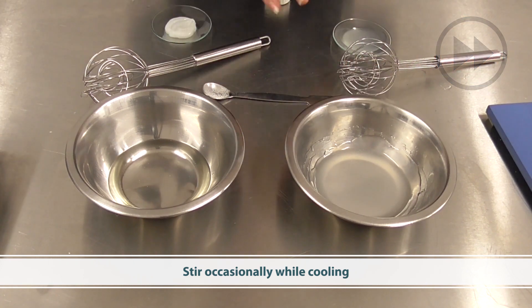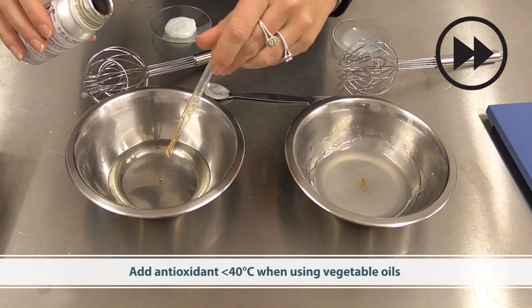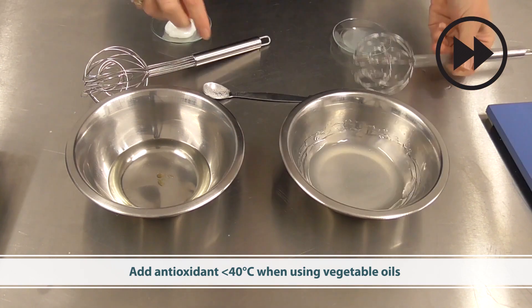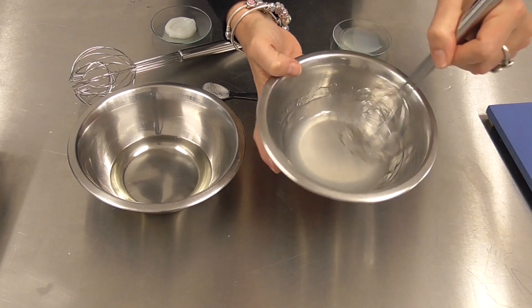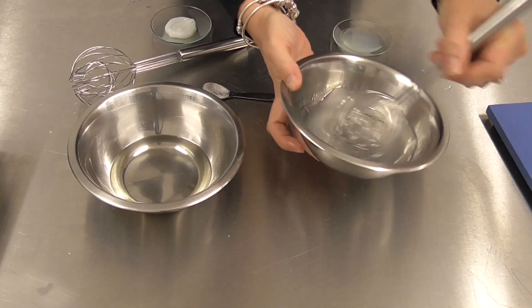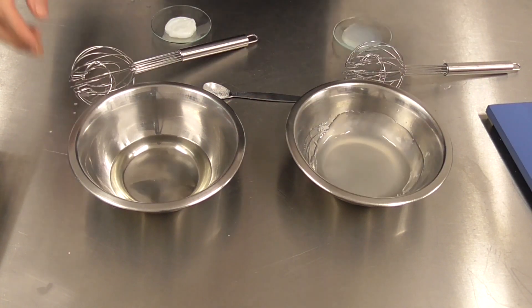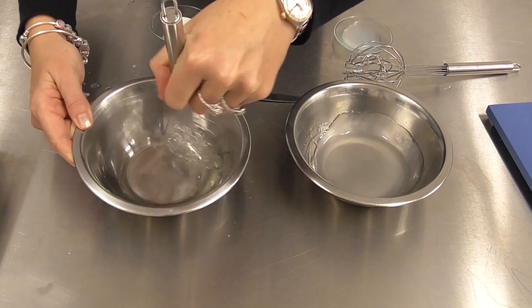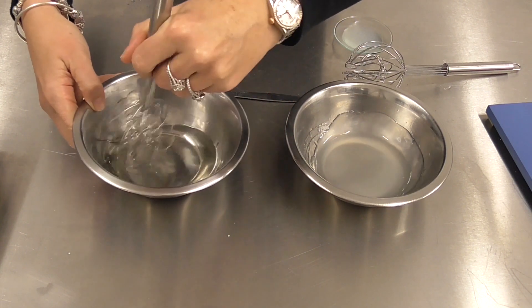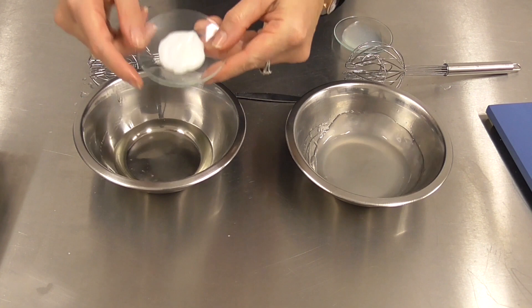Make sure you stir occasionally as the product cools, and when below 40°C add the antioxidant. As you can see, this one here has already started to form its gel structure and by tomorrow it will look exactly like this. This one here with the hydrogenated vegetable oil is still yet to form its structure, but it will as it cools and by the next day it will look like this.